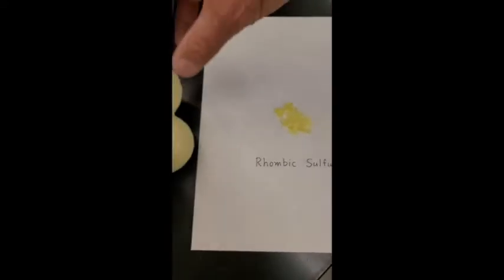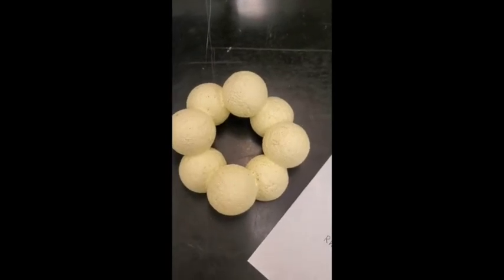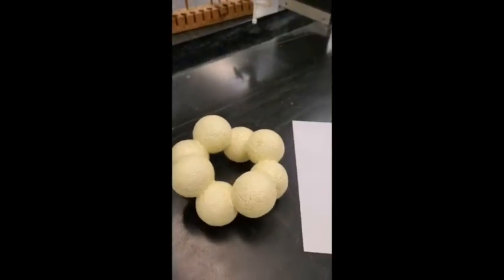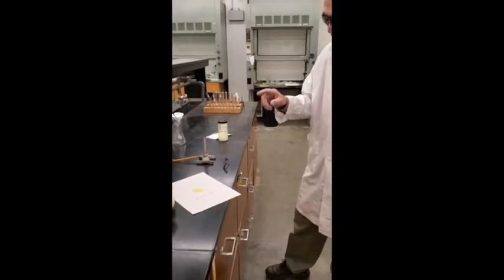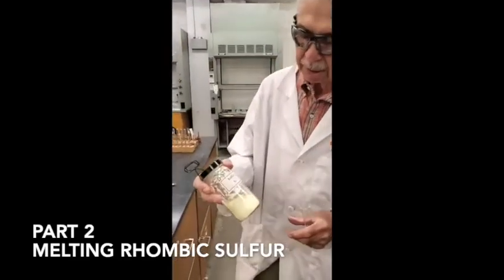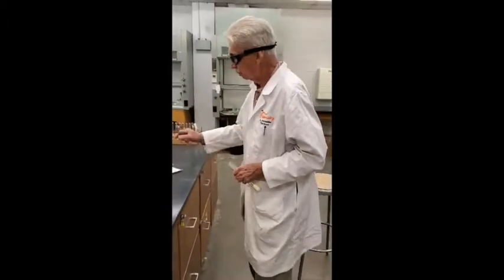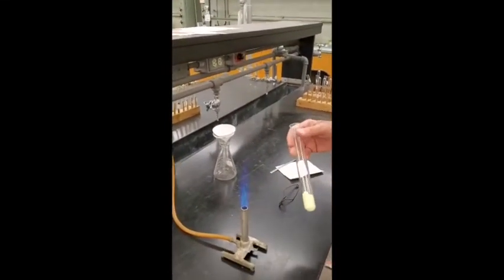This is a model of the molecules you find in rhombic sulfur. The formula is S8 — S8 molecules. When you heat this up and melt it, another form of sulfur forms: the monoclinic form, which is stable at higher temperatures. If you melt this and let it solidify, you'll get the monoclinic form, which forms needle-shaped crystals. So we're going to do that right now. I'm going to take some powdered sulfur — it's still rhombic sulfur, just small particles — and melt it, then pour the liquid into filter paper and let it solidify. It'll change into monoclinic sulfur, a different crystal structure, but still S8 molecules.